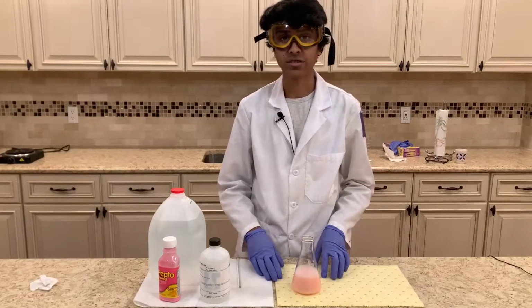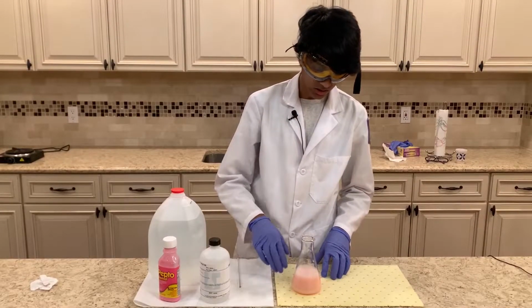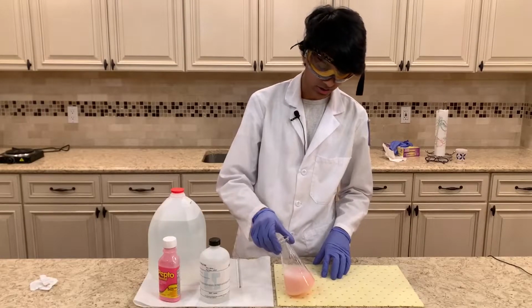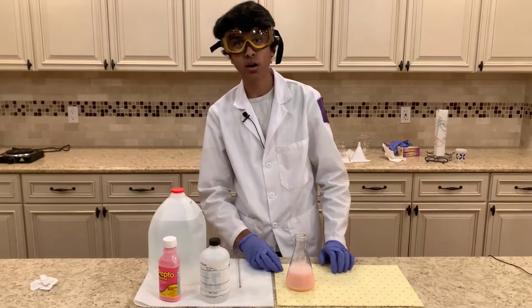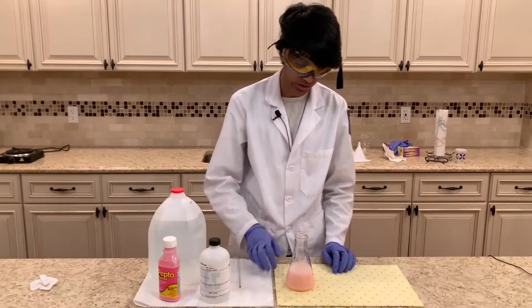So I've let this reaction sit for around 30 minutes now while regularly mixing it. So we should have some bismuth chloride and some salicylic acid in this as well. And now we can move on to our next step of separating the bismuth from the bismuth chloride.